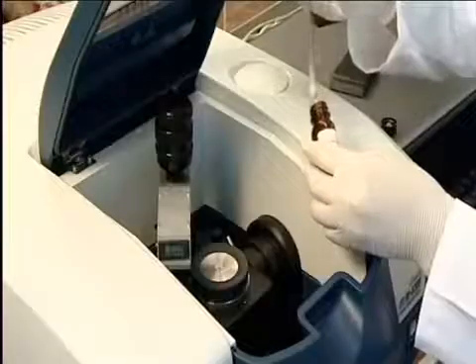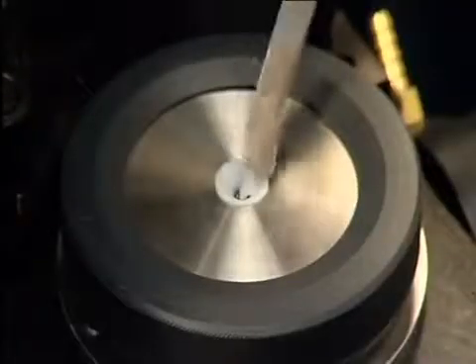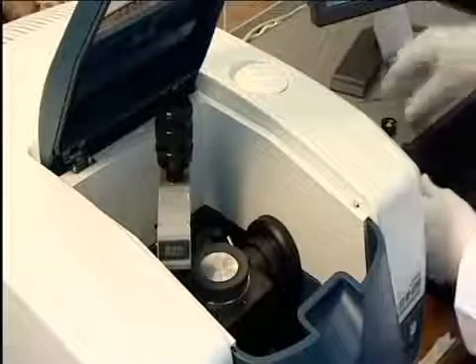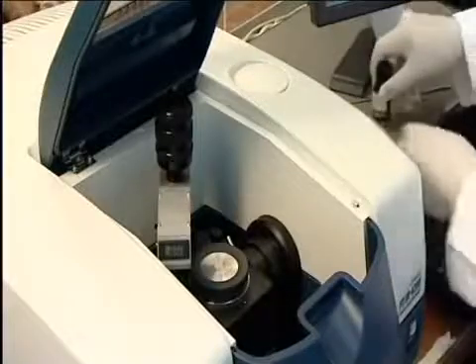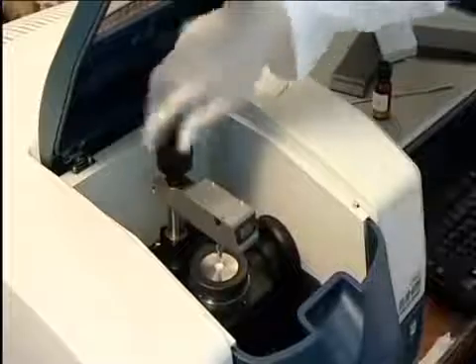A little benzoic acid is placed on the ATR crystal. This is a holder for solid samples. Less than a milligram of solid sample is required. The torque wrench is used to squash the sample to ensure good contact with the surface of the crystal.